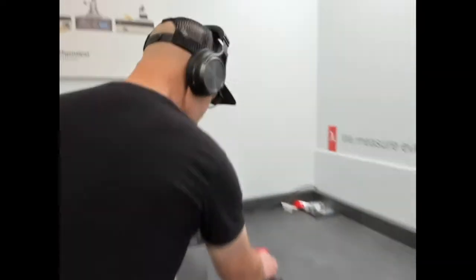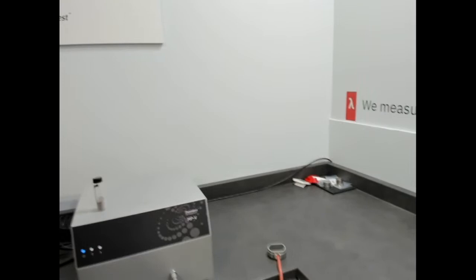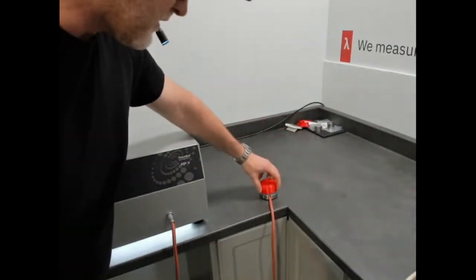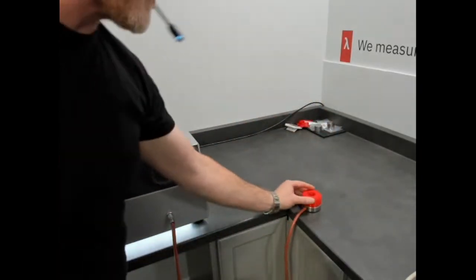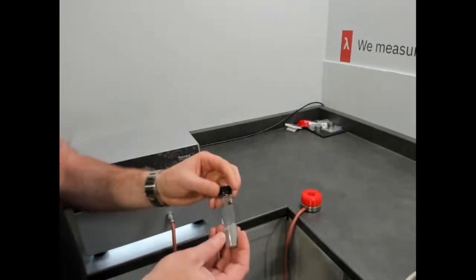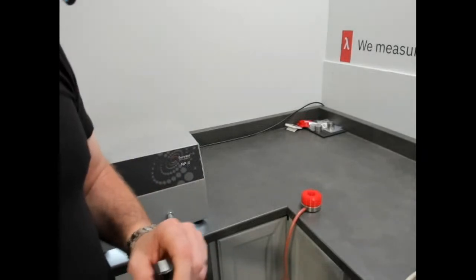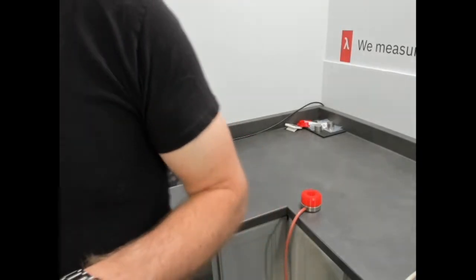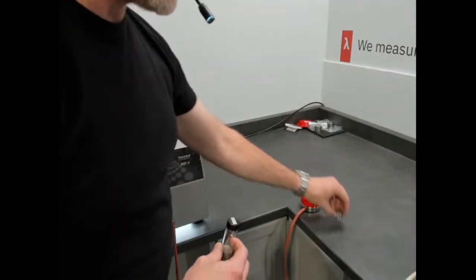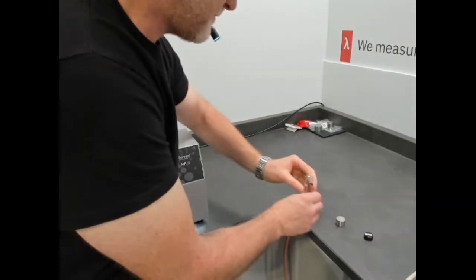Ideally, you place your MTPS sensor on a flat surface where you're not getting any vibrations. We're not going to measure a solid, we're going to measure a powder. Hopefully, is that a good angle? Kinda. We're going to pour the powder directly into it and use the weight. We're just looking for the weight. Okay, we'll be using this one. So I'm going to pour the powder directly onto the sensor.